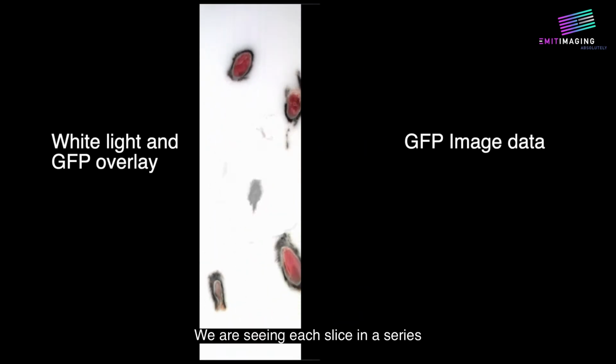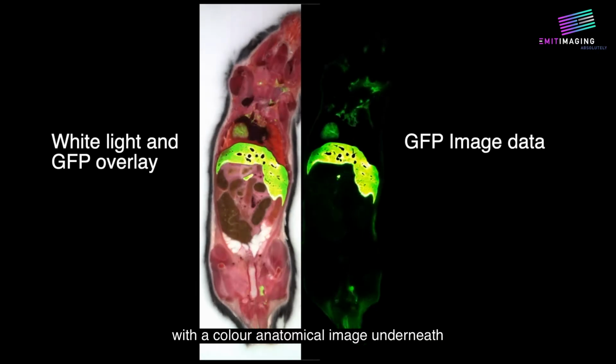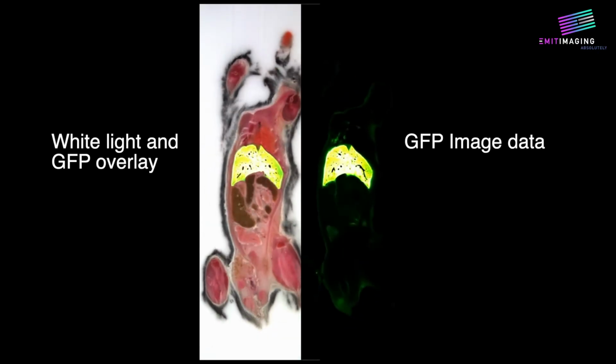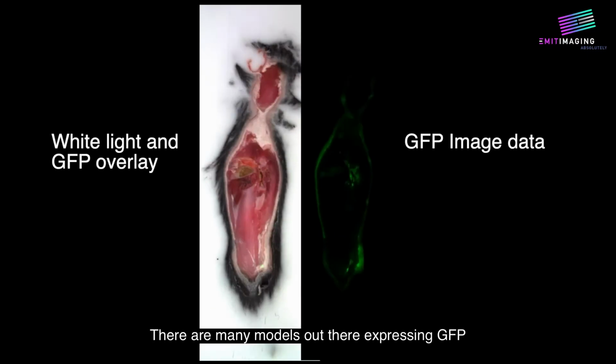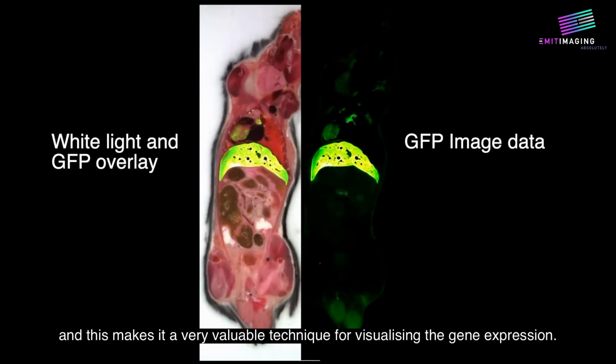We are seeing each slice in a series as it would come off the block, with a color anatomical image underneath a green GFP channel image. There are many models out there expressing GFP, and this makes it a very valuable technique for visualizing gene expression.